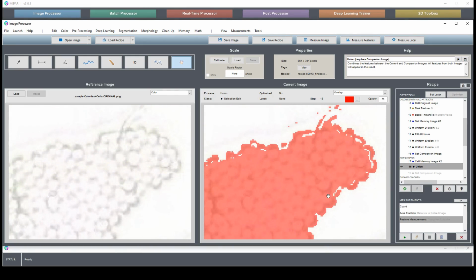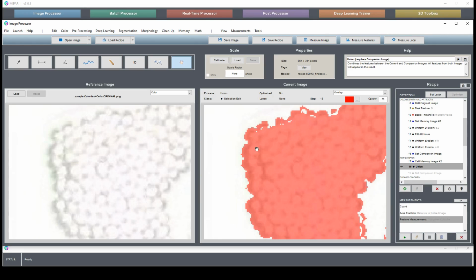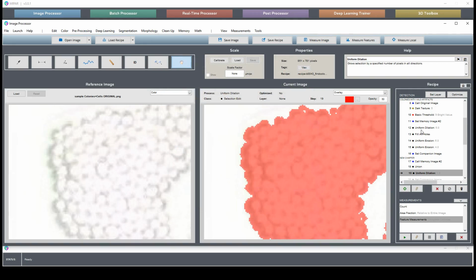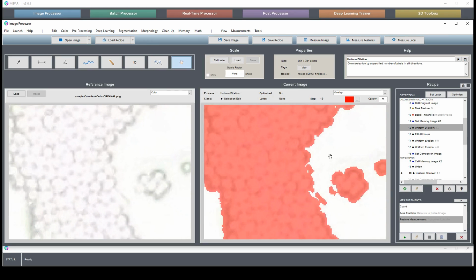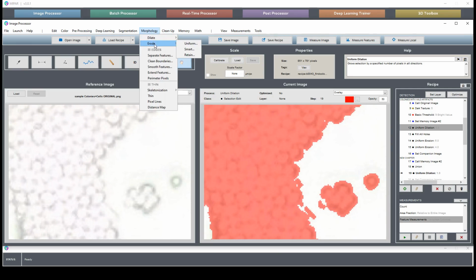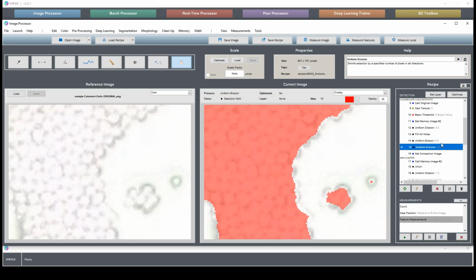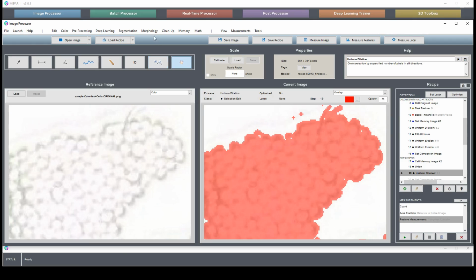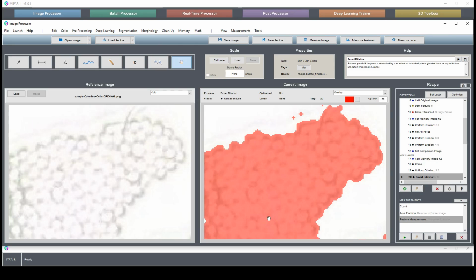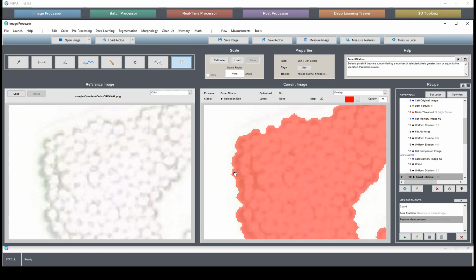Now we can do some gentler cleaning to fill in these tiny holes without obliterating these corners. So say I dilate just by 1, not by the 5 or 6 that we did before. Right, so I dilated by 1, and then I'll fill in a little bit of this tight inset with our smart dilation. Excuse me, I'm on the wrong step. Here. We'll fill in with our smart dilation. Threshold of 5, about like so. Right, now we have a much tighter selection that follows these concave edges better.